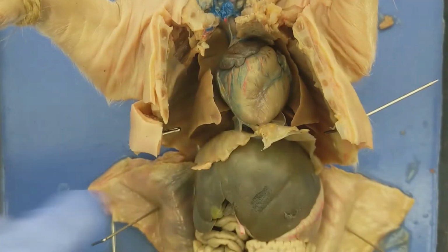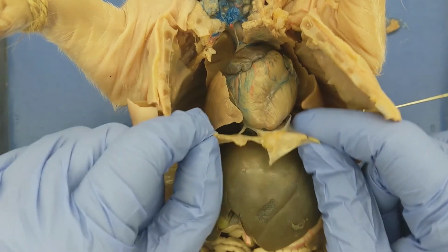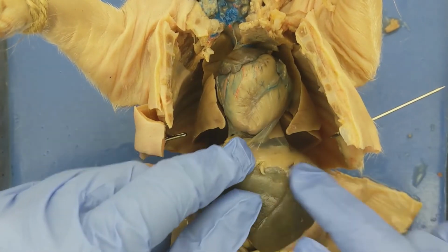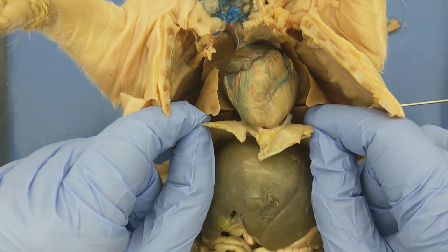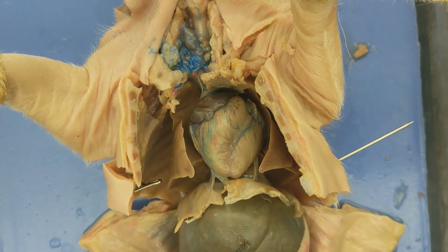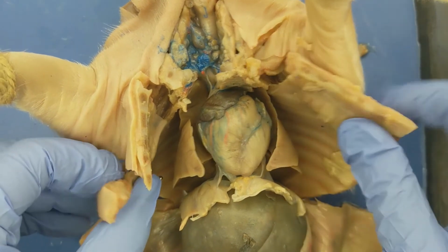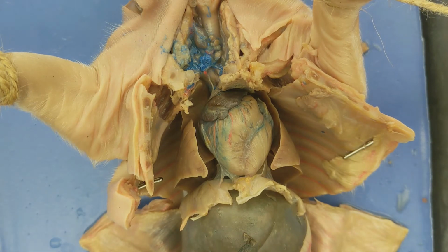This muscle that I'm holding in my fingers, it looks like a thin flap of tissue, right? Not the dark brown thing, but this thin flap of tissue. This is the diaphragm. The diaphragm helps with breathing. It pushes up and pushes down as you breathe, or as the pig breathes as well. Largely, when we take a look at the thoracic cavity, the organs that we see here are associated with the circulatory system and the respiratory system.